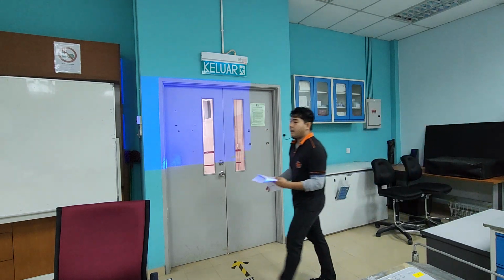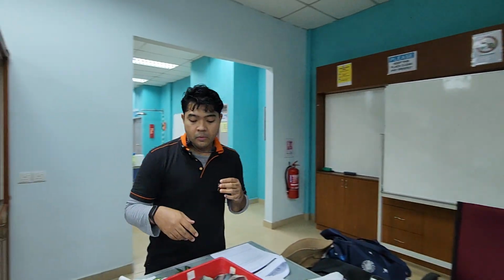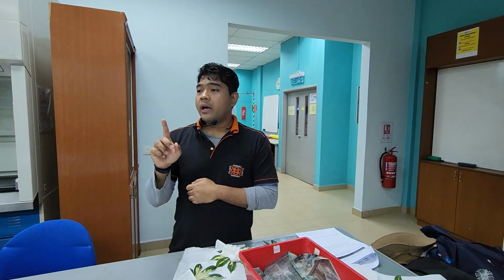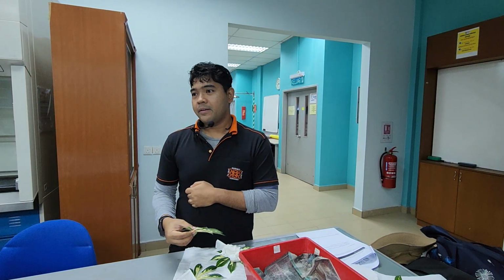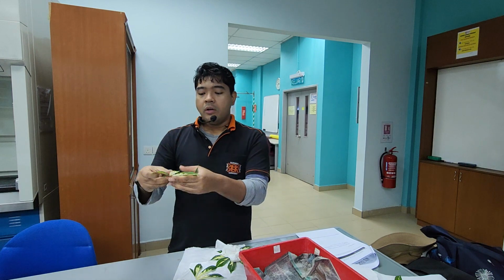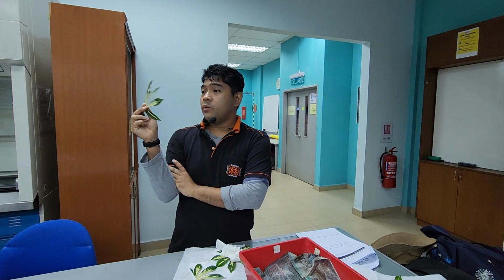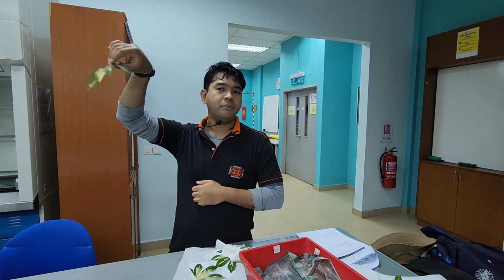Let's come back to the first leaf area activity. I just want to save time. Do you still remember how to use that machine? Yeah. It's quite easy, right? Right, so it's rather easy. The specimen that we're going to be using today is this plant. What plant is this? Tapioca. Really?